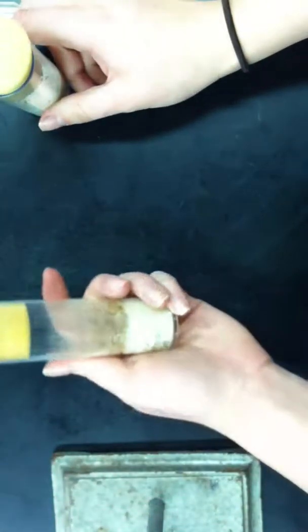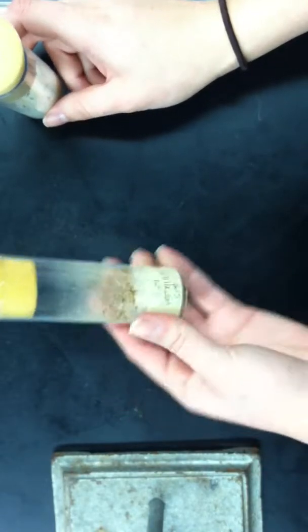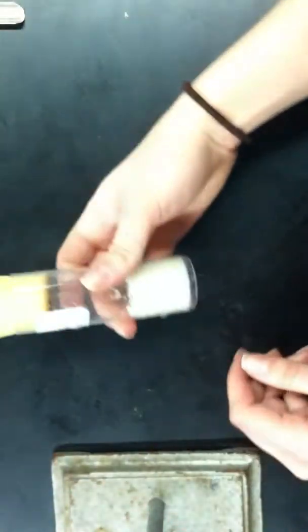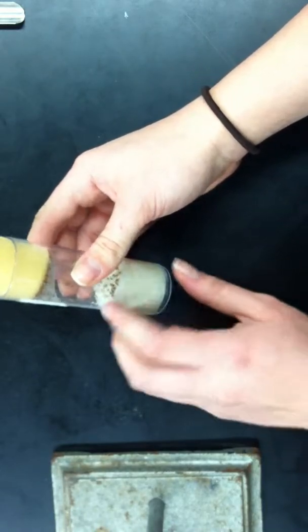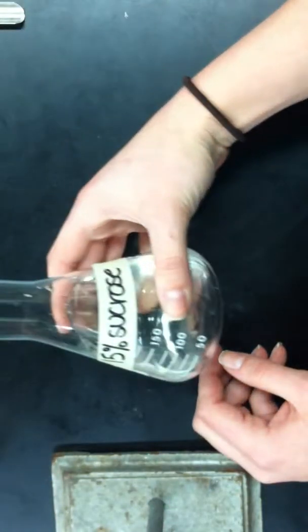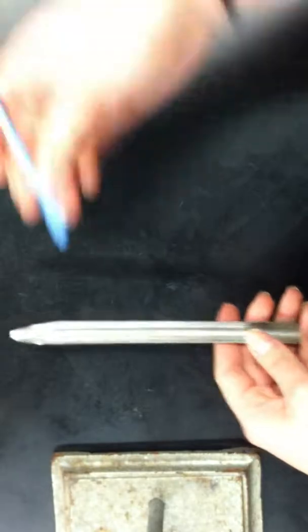First, you're going to need a fecund Drosophila vial, followed by an empty vial. I already transferred the adults, but you're going to need to create another one to empty the adults into. A pre-made 15% sucrose solution, a sterile Petri plate, a scoop, and a paintbrush.